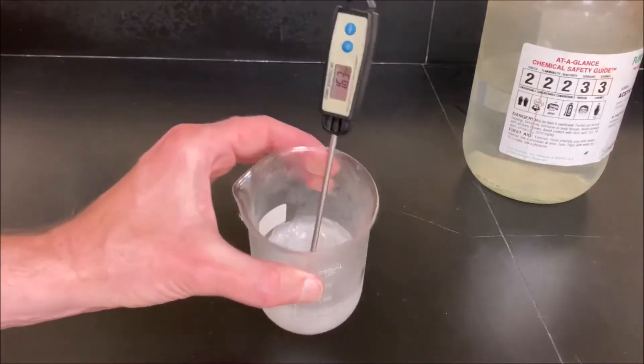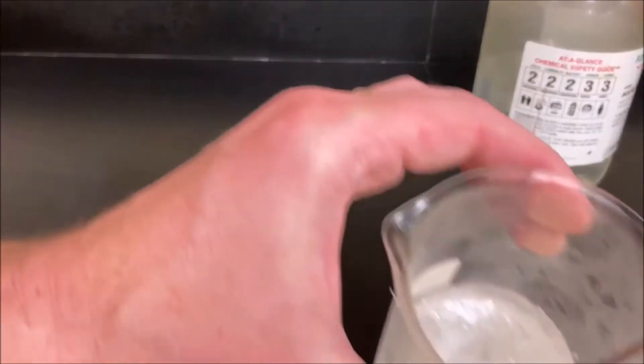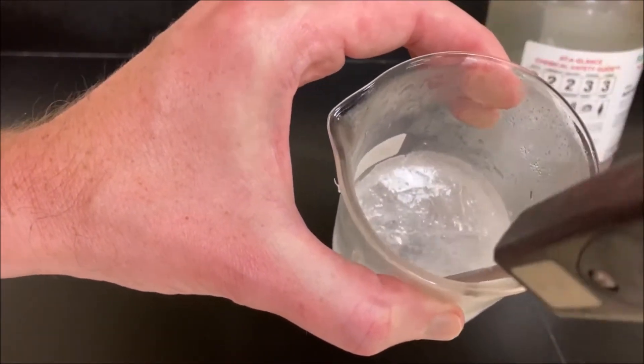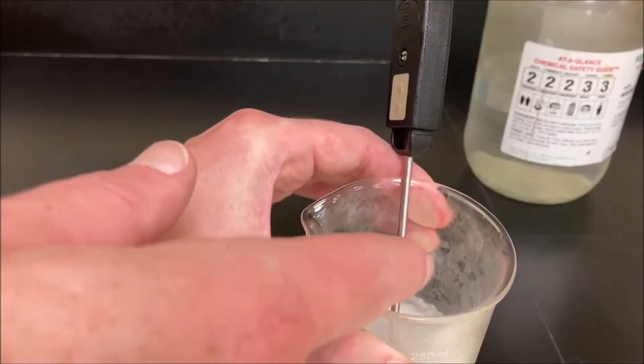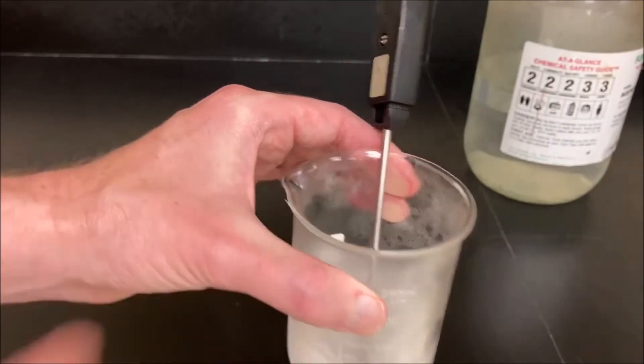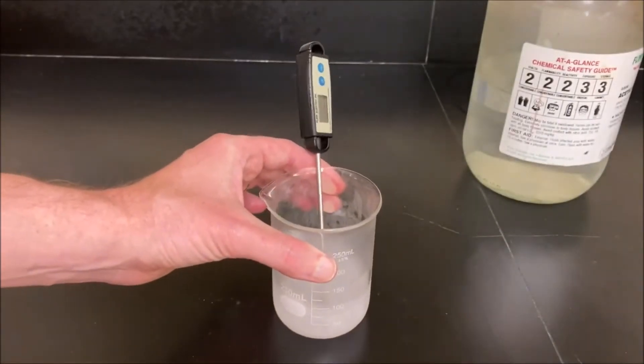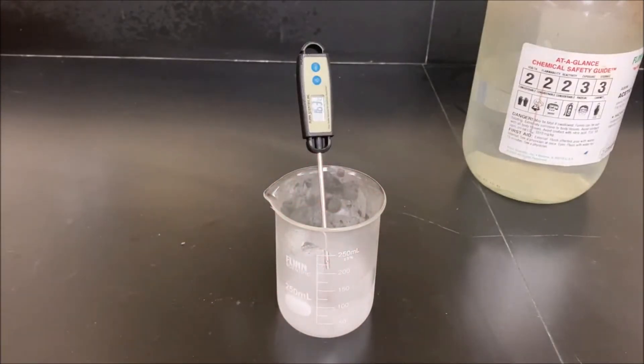So we now have taken this out of the freezer and it's already started to melt. That's a little bit unfortunate. Before that we had some very cool patterns where some of the vapors potentially had frozen up high, so I'm going to bring out a second one and look at that.